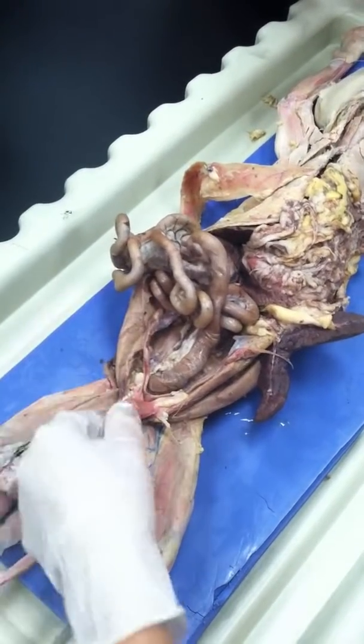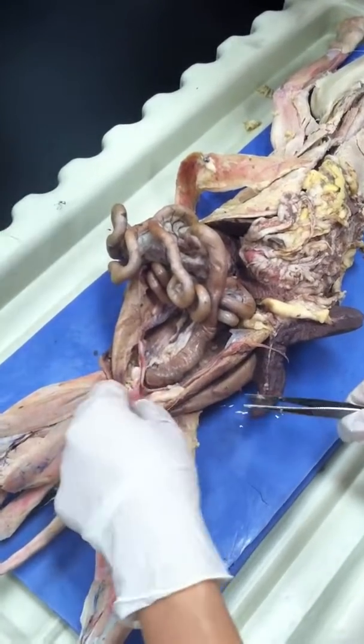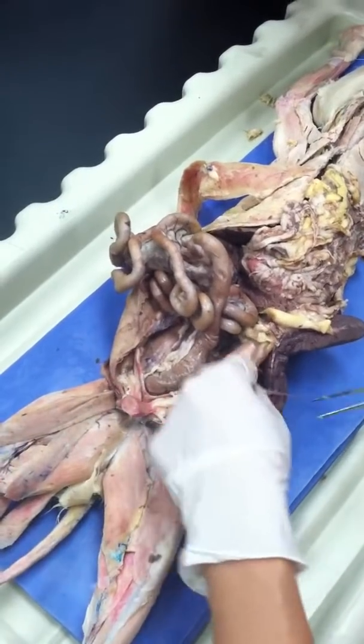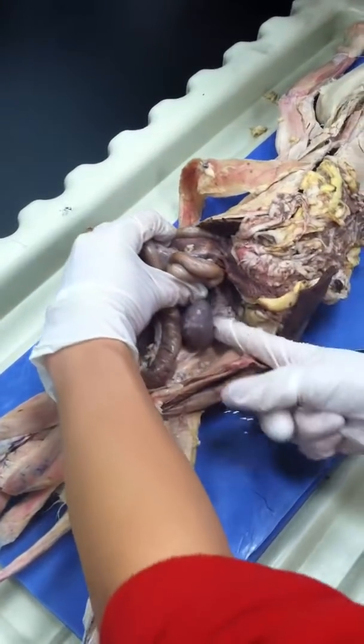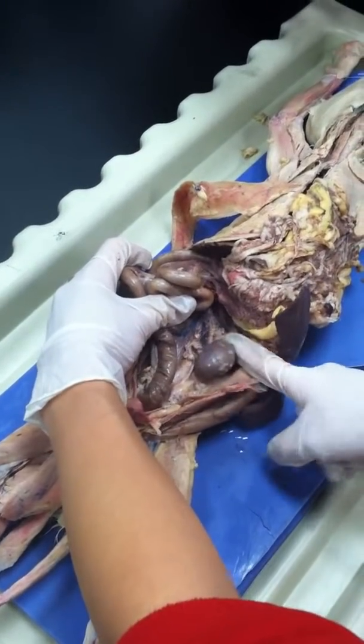Where's the bladder now? The big thing. That is the bladder. And see, they enter right there, and these are the two tubes and the ovary at the end. And you have your kidney over here. The kidney is well dissected, but no adrenal gland.